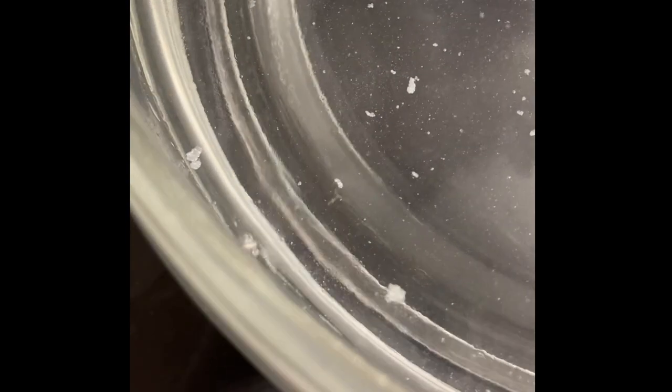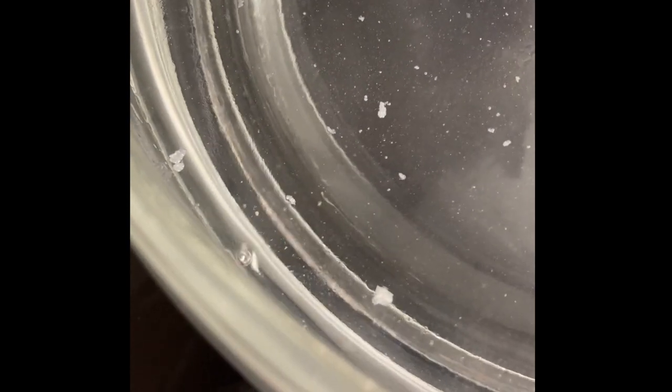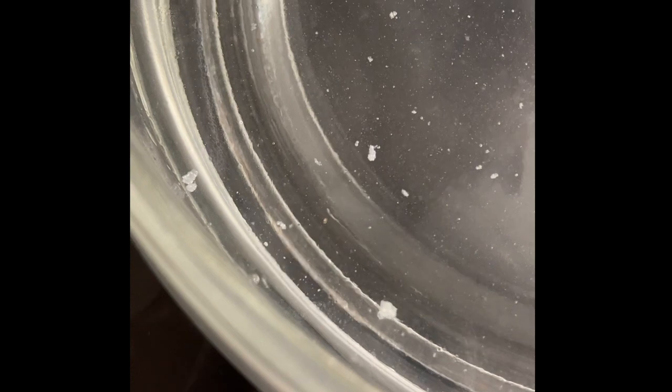All right, so see how fast that reacted? And it's gone. Last little piece. That's it.